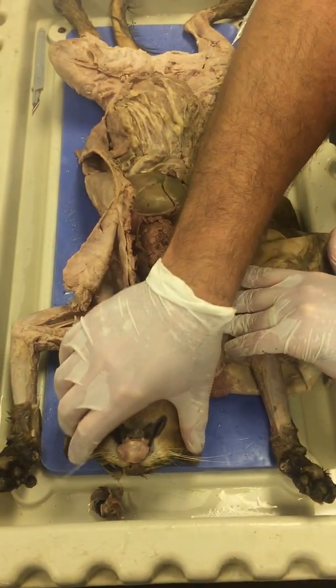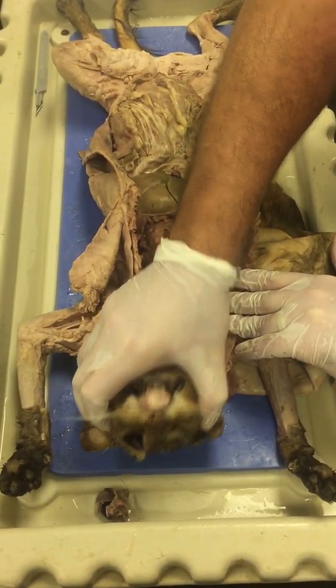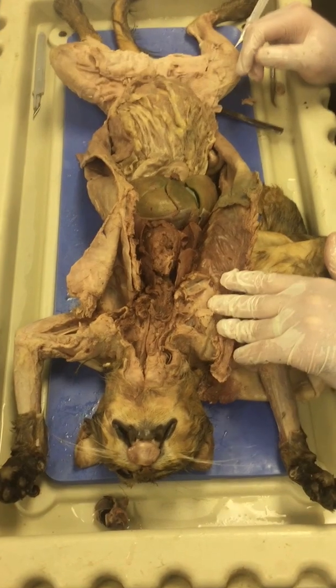Let's go up. We'll do respiratory here, and then. All right, you ready? Mm-hmm.